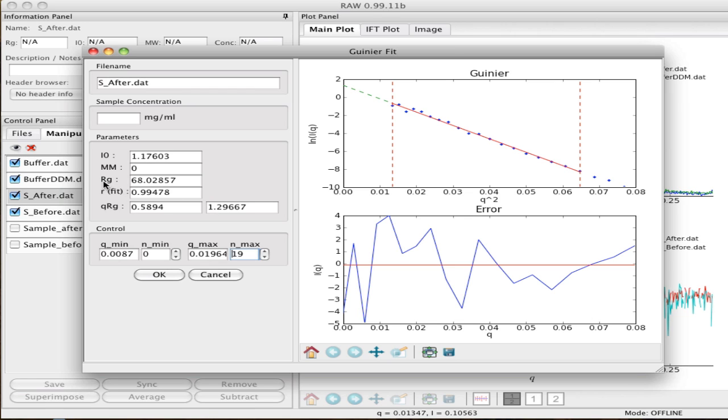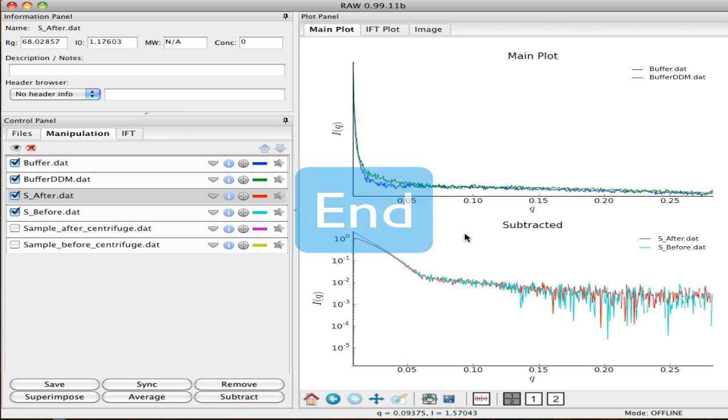And you'll notice here that the Rg is 68 in this particular sample. That concludes this demonstration.